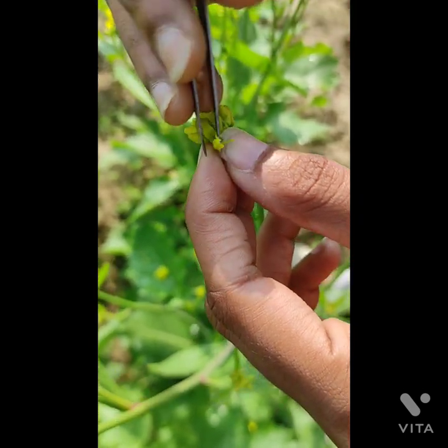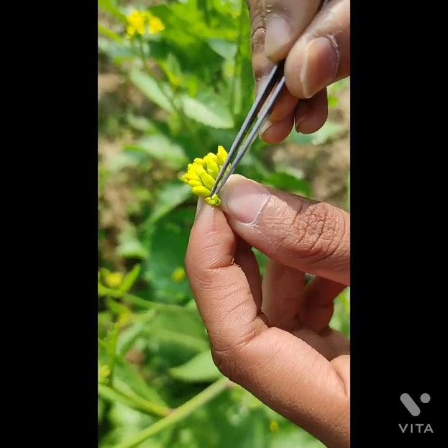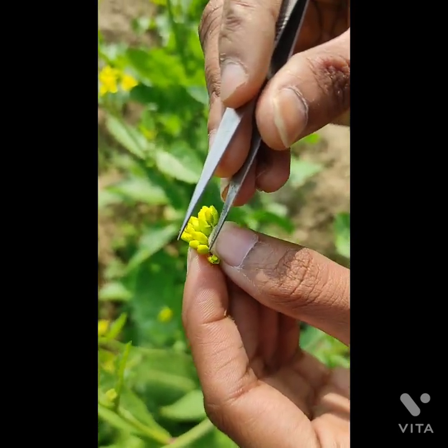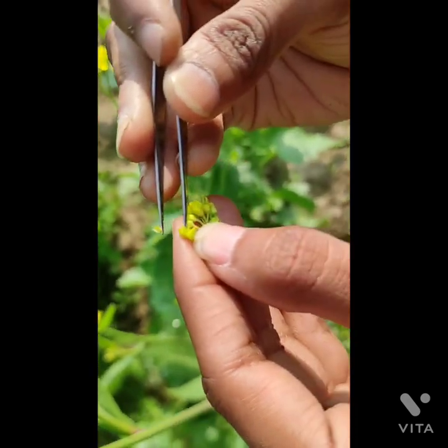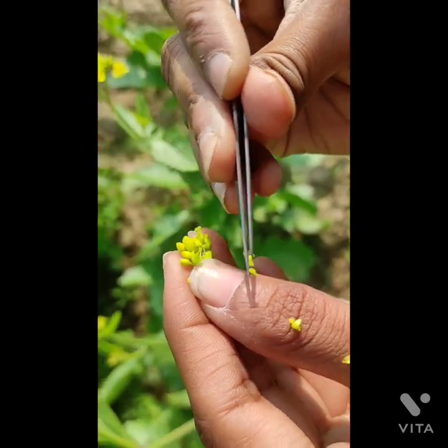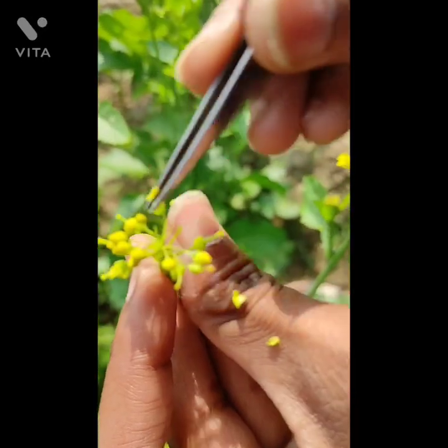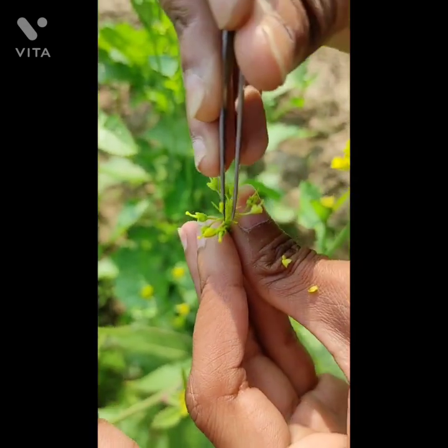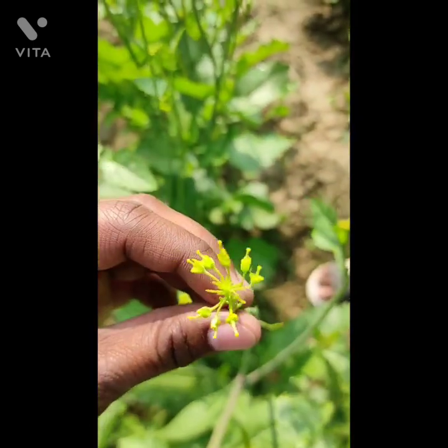You can clearly see here how to remove the stamens. Repeat the same process in 8 to 10 mature buds. For the first time it may be difficult to do this, but it is very important to learn as breeding students. Emasculation is done to prevent self-fertilization in the flower of the female plant. Only the female part, that is the gynoecium, should be left without any damage. Nearly 8 to 10 buds should be emasculated to have a good result.